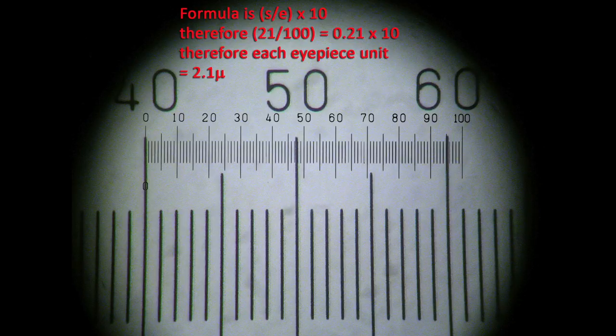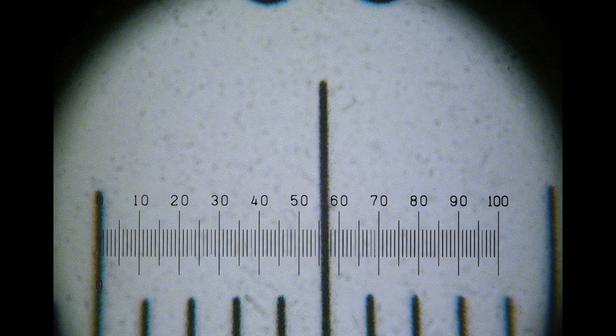After setting this up and refocusing, and with the slide scale again positioned so that the zero point on the IP scale is aligned at an appropriate marker on the slide scale, you should see something like this.